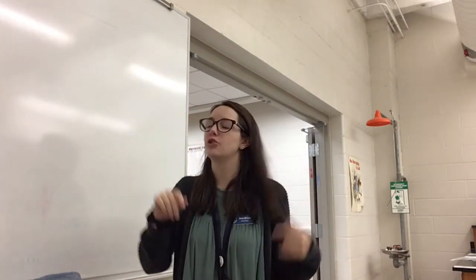Hello gentlemen, today we are completing these physical and chemical change station labs. You don't have to submit anything to me. I will go through in the end and discuss what was a physical change or a chemical change. Throughout this process, your responsibility is to go through and write down whether you believe each station was a physical change or a chemical change and why. I'm going to go through each eight stations, perform the experiment for you, and then discuss which category each one falls into.